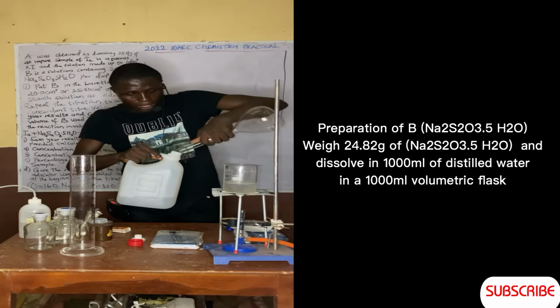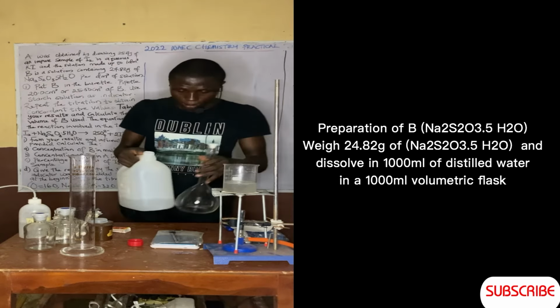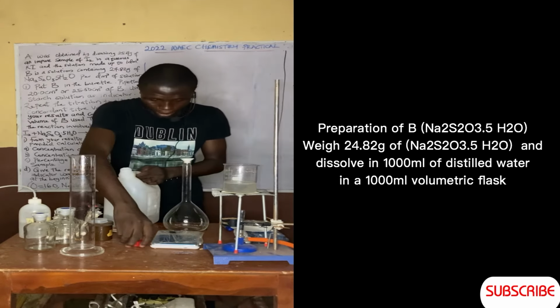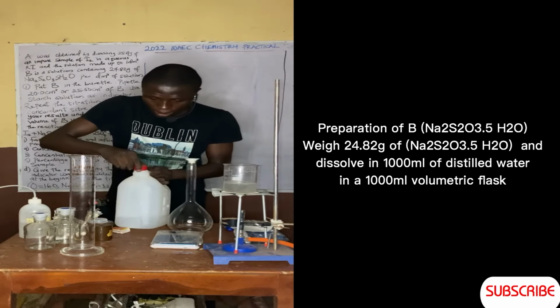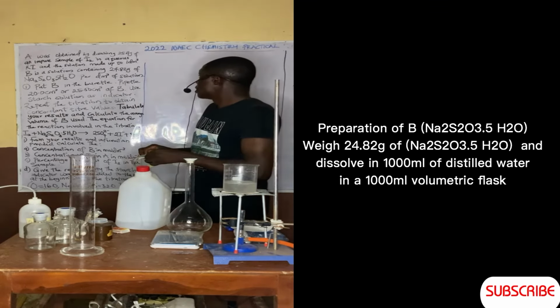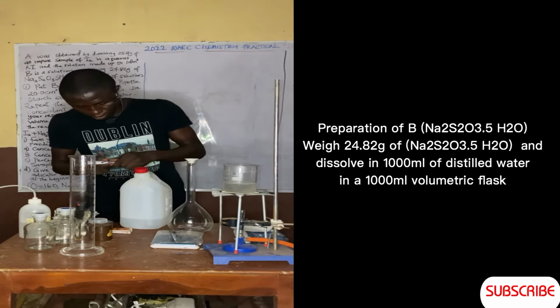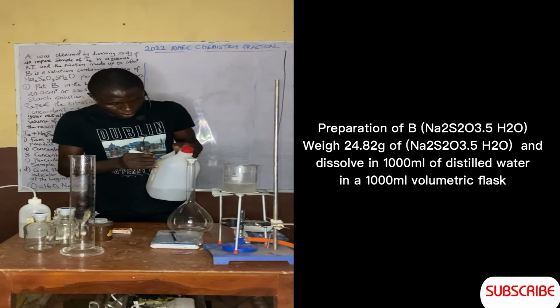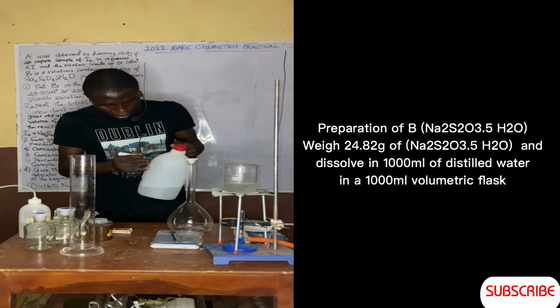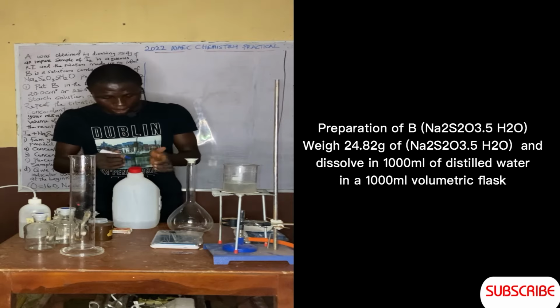So this is to be labeled what? Is to be labeled. So we have to label this one. When it is selected, we have to label it B. Let me label this one now. So this one is B, sodium thiosulfate. So that's that.